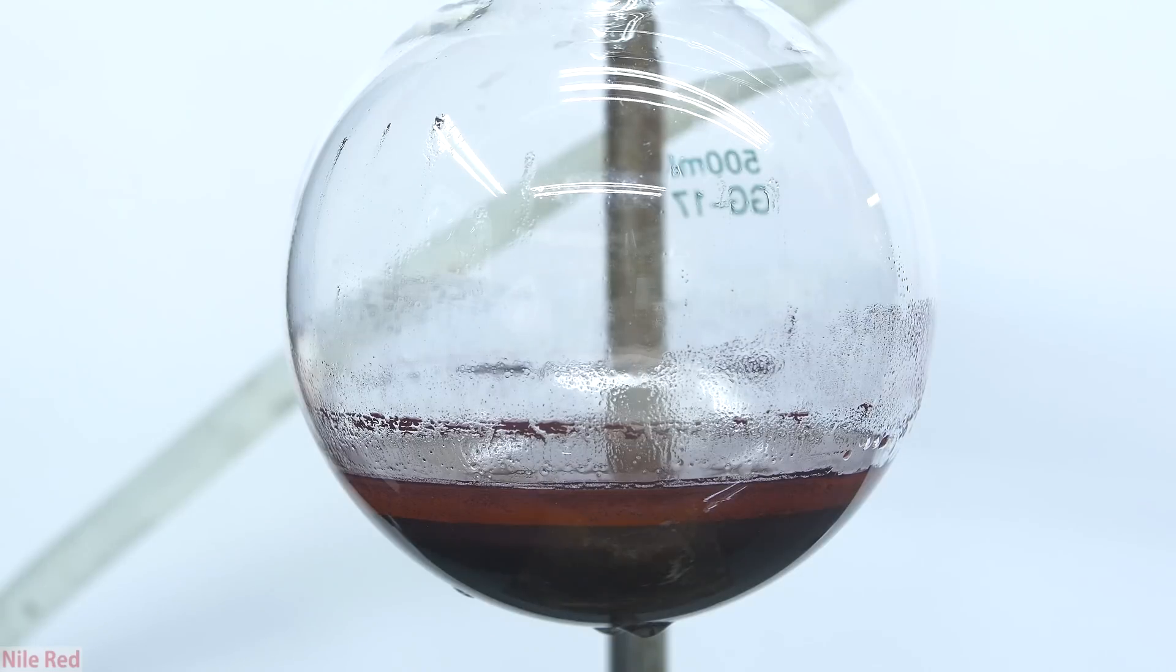When we look back at our distillation flask, we have a red colored methanol solution and a lot of red phosphorus at the bottom.